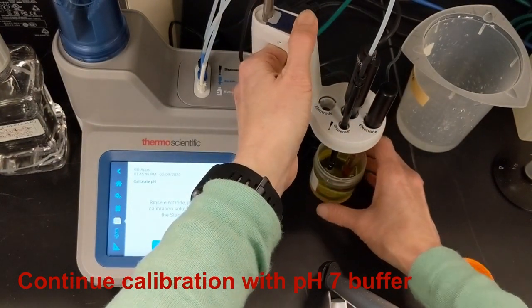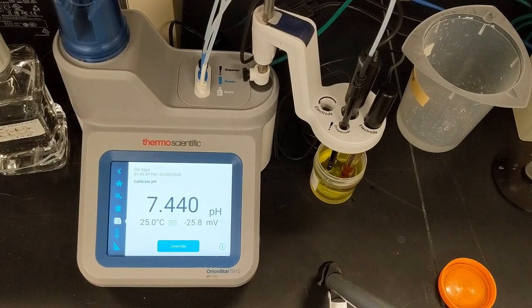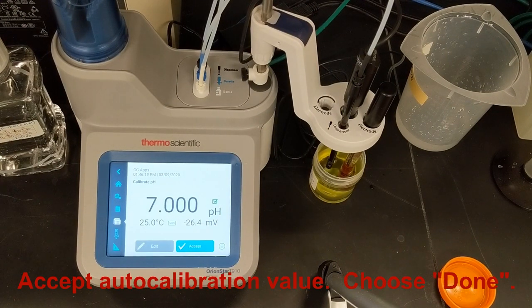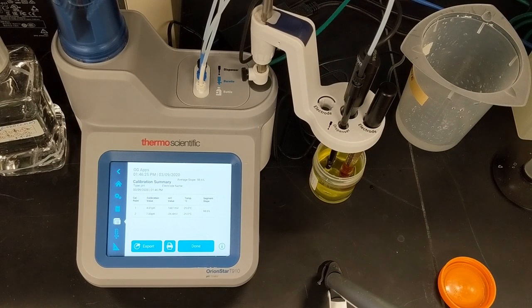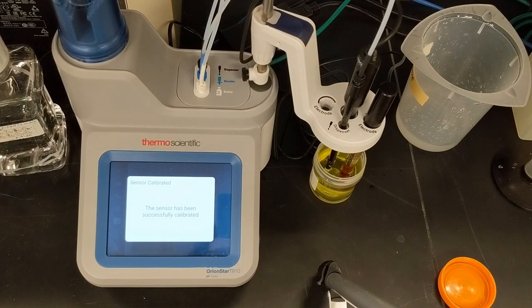I'll touch Start to continue the calibration and wait for a stable reading. When the reading stabilizes, I accept the AutoCalibration value, then choose Done to complete the calibration. The slope value and details of the calibration are displayed and automatically stored in the titrator data logs.